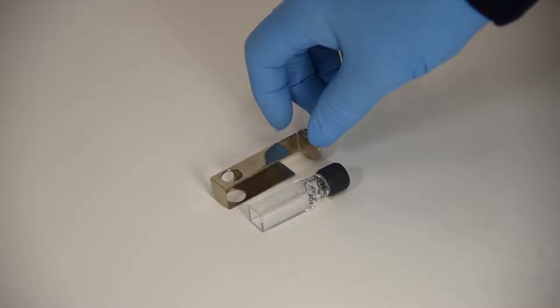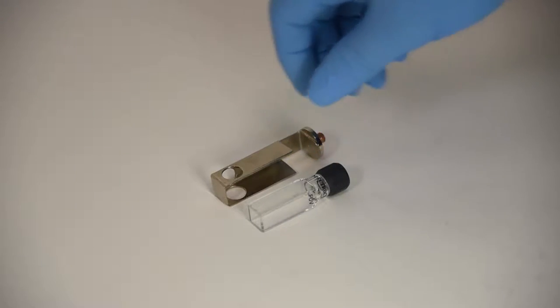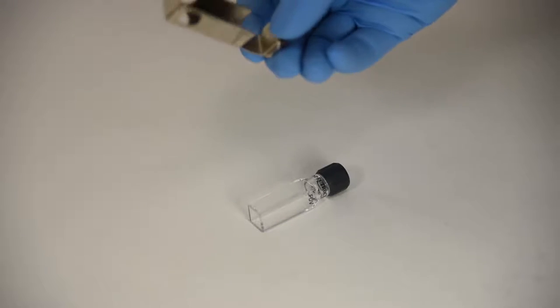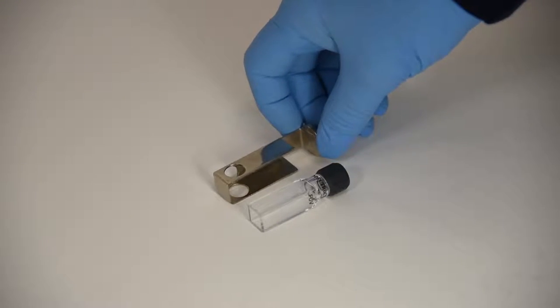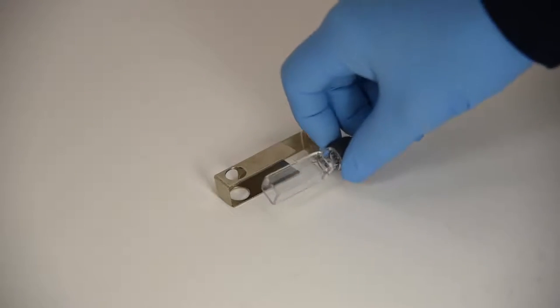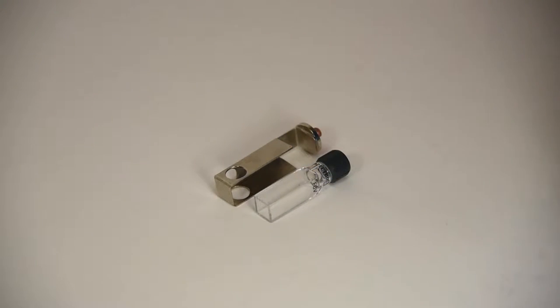Right now what we're looking at, this is our liquid cell and dry cell sample holder. This is OFHC copper and it's nickel plated and this is your cell, comes in a couple different varieties.